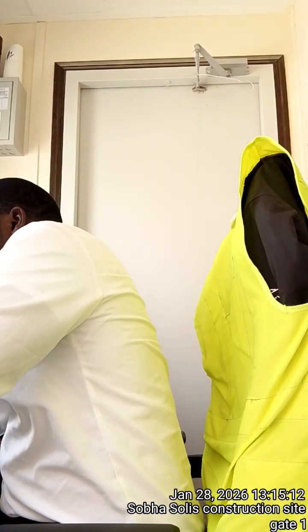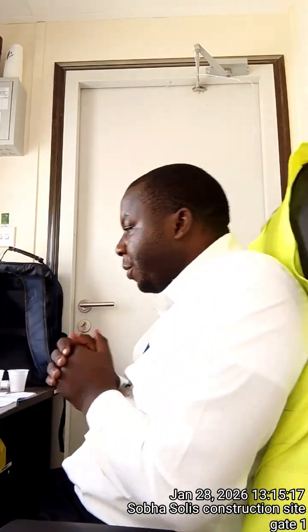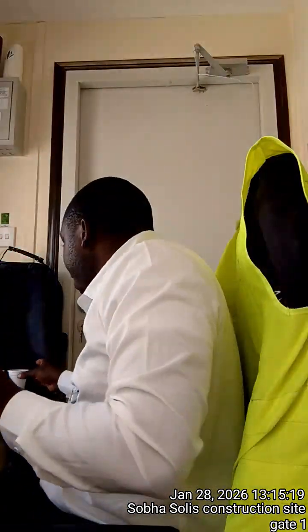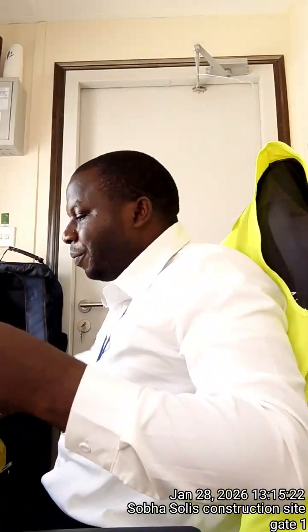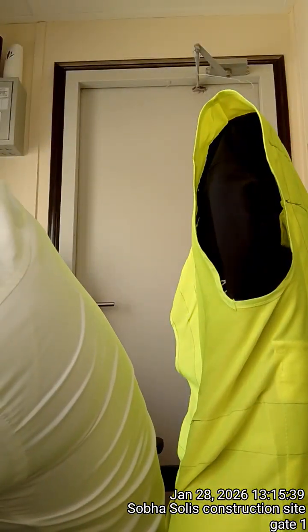So when you look at this, you see that color there. I have a pink color inside my cup, and I'm going to use this one to identify the different pH in my water, both the tap water. If you remember, this is tap water. This cup was not tap water. Yeah, it's clear. So to this one I'm going to add my drinking water, the purified water.